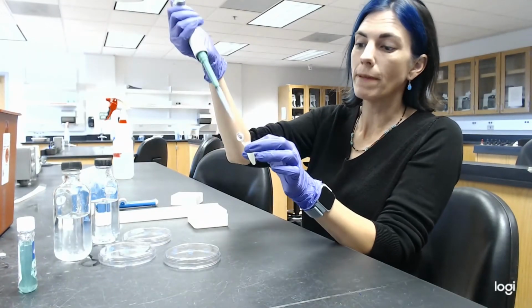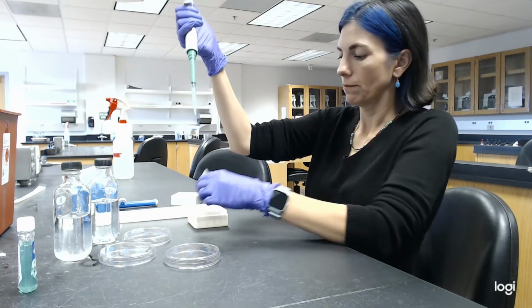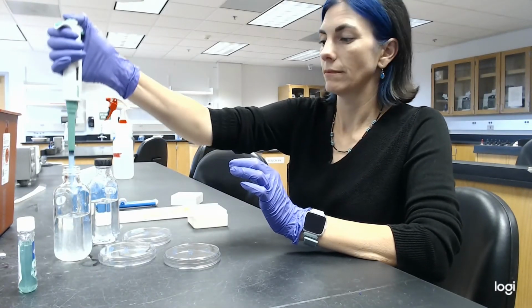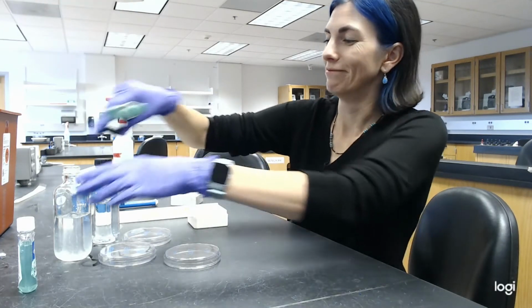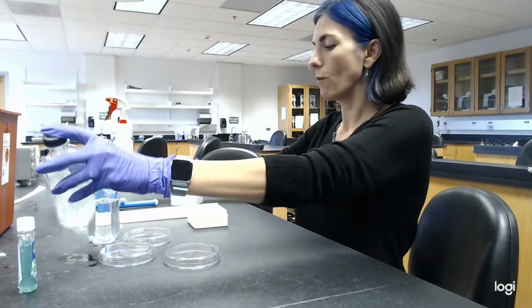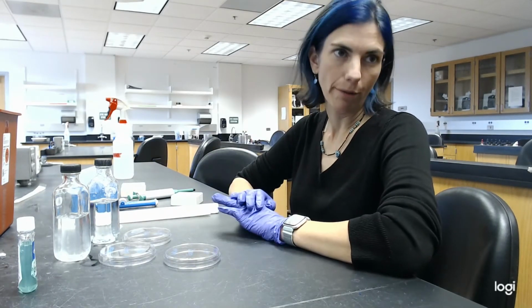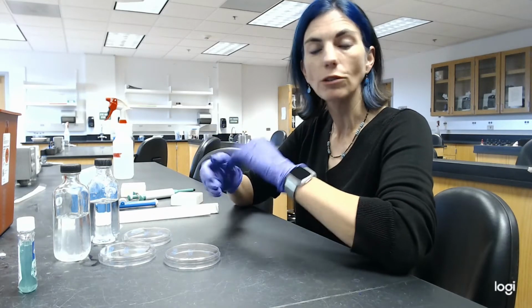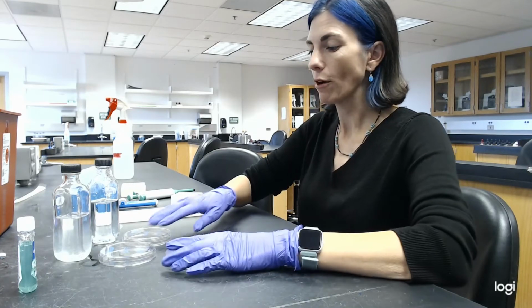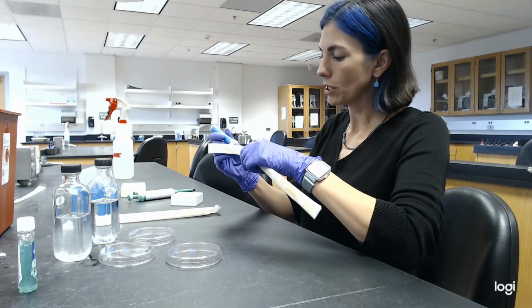So now I'm going to take 1 ml from this solution and mix it into bottle A. All right, we'll go ahead and mix bottle A really well. And now I have a little bit of time because I've done my first dilution, which stops the reaction of whatever was in scope that was killing the microbes. So now I have some time to make sure that I do my serial dilutions correctly and accurately.